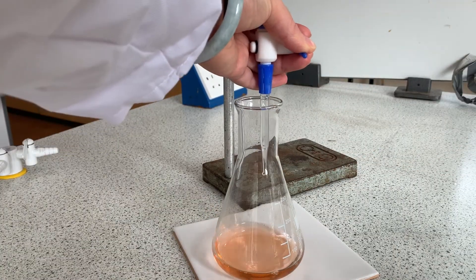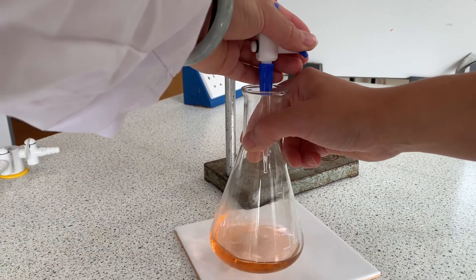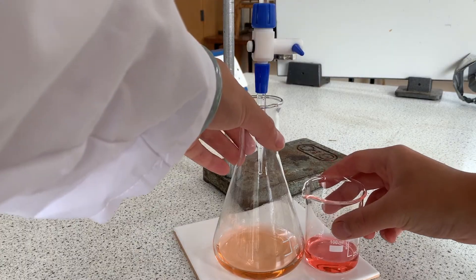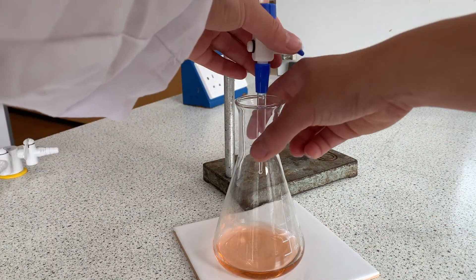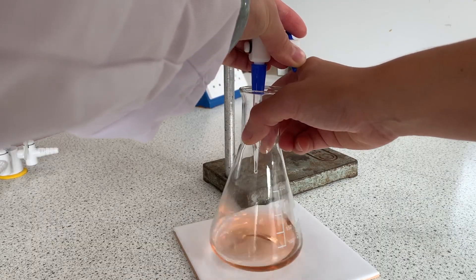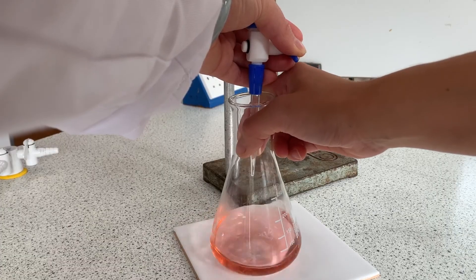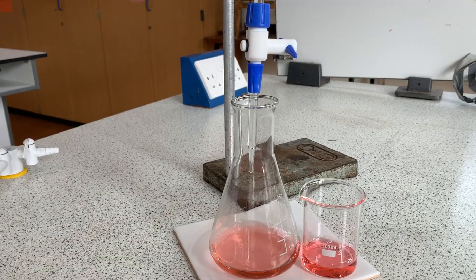At one point it started to look like the colour change was there or almost there. Because it seemed slightly ambiguous, I took the acid beaker with indicator from earlier to compare the colours. It still wasn't quite the right red so I kept going, cautiously adding the acid drop-wise. Eventually the solution reached the correct red colour, so the titration stops there.